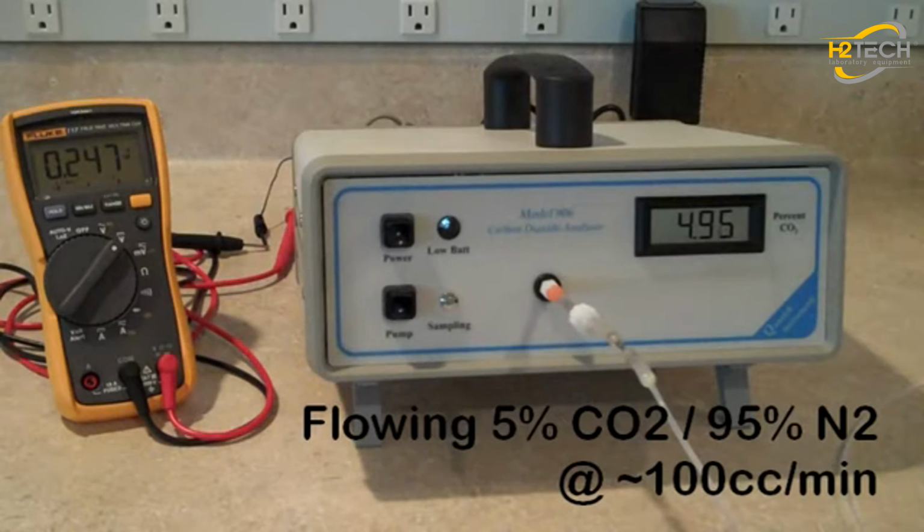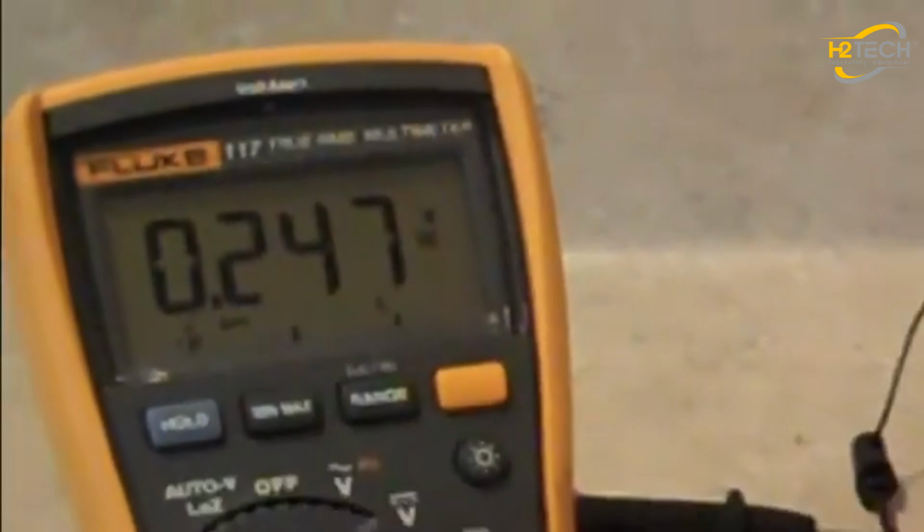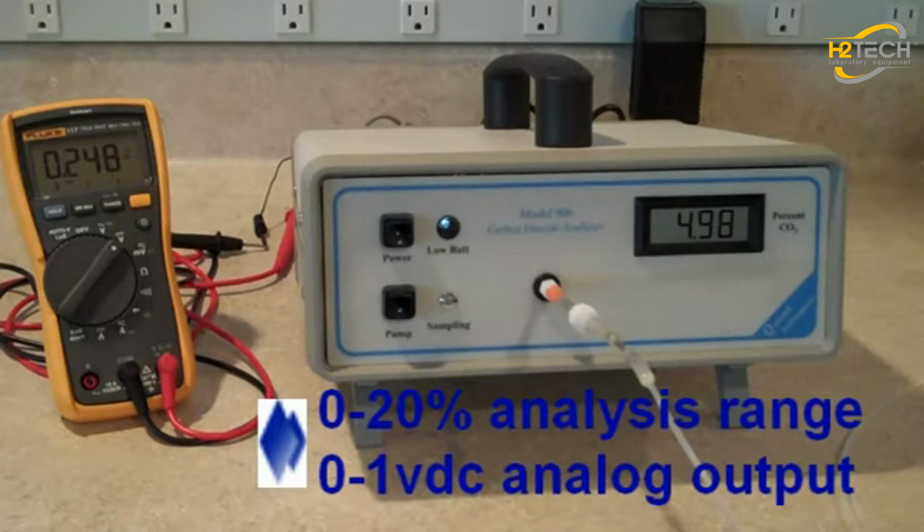your readings. And as you can see on the left, the voltmeter is reading about 250 millivolts because for this particular analyzer, the analysis range is 0 to 20% and 0 to 1 VDC in linear relationship with each other.